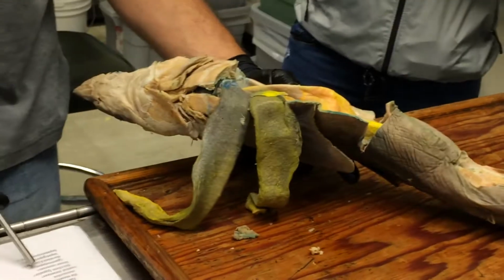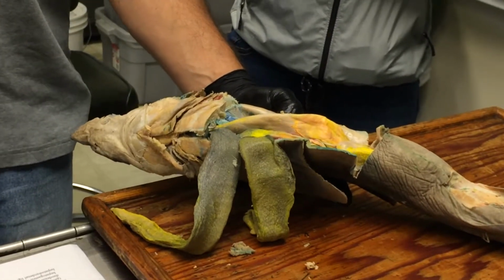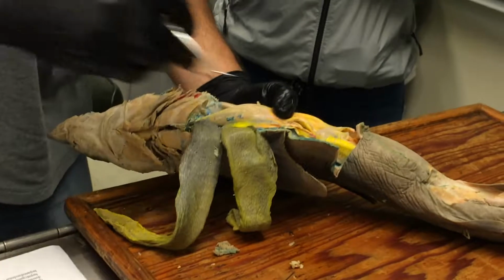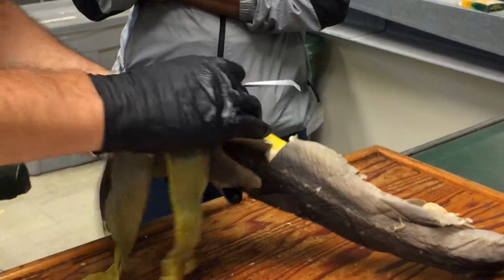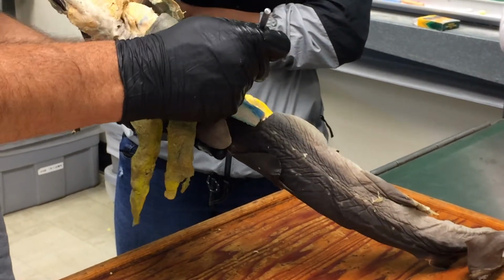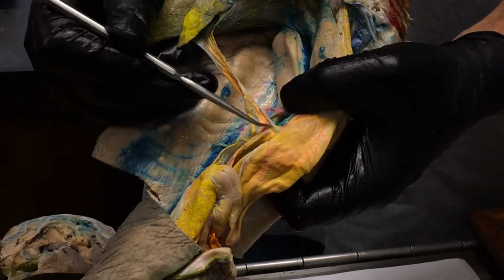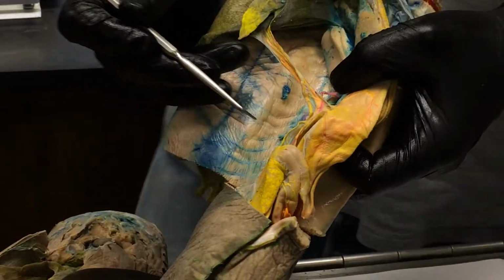So if we look down here, we see lesser omentum has in parentheses after it gastrohepatoduodenal ligament. I'm fine with lesser omentum, if you don't want to say gastrohepatoduodenal ligament. But there is a split in the lesser omentum into a hepatogastric and hepatoduodenal ligament, and I wanted to show you that. So here's the lesser omentum, and you can see one line of it comes over here to the stomach. That's the hepatogastric ligament, and another one comes over to the duodenum, and that's the hepatoduodenal ligament. So for you guys, here's the hepatogastric ligament coming to the stomach, and hepatoduodenal ligament going to the duodenum. Okay, does that make sense?